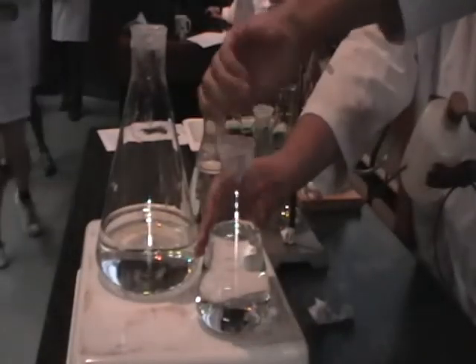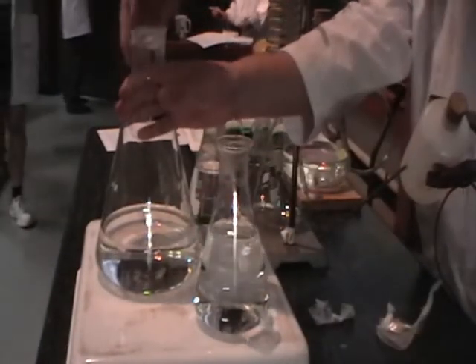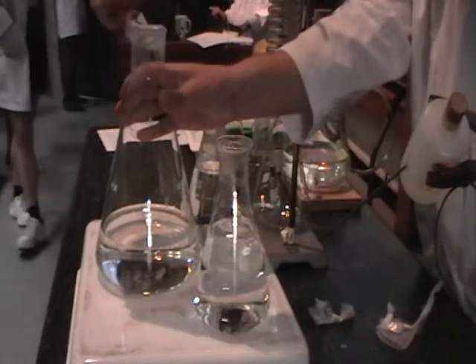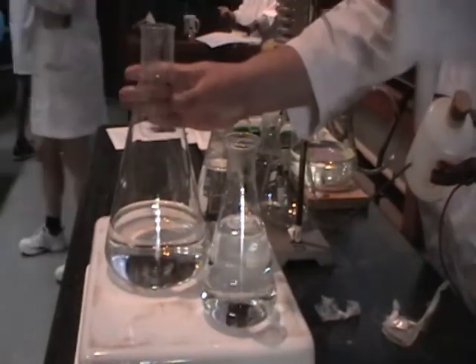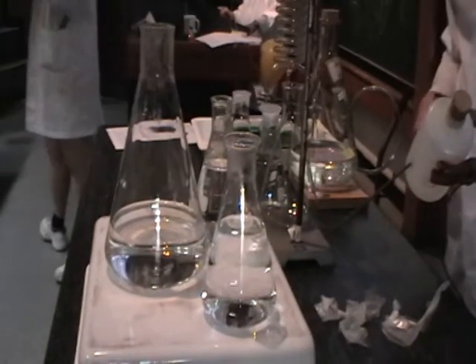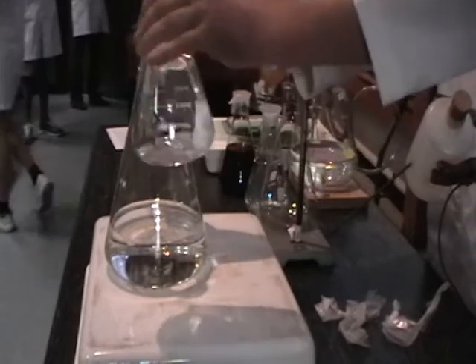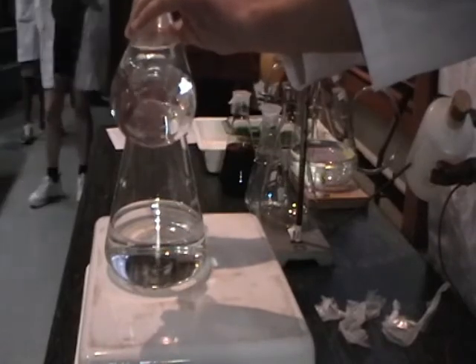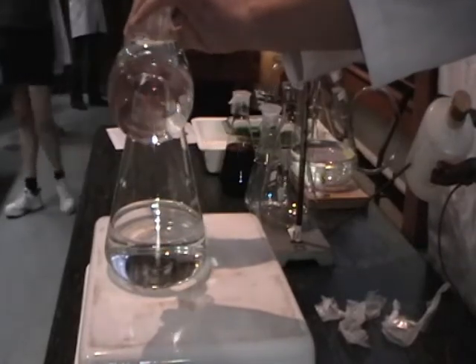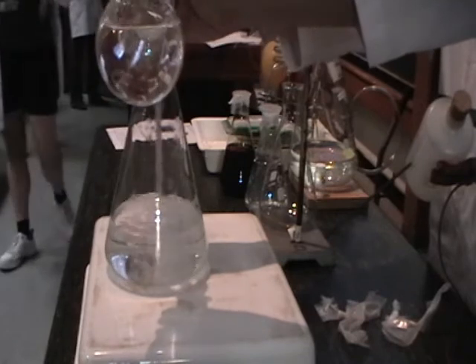Basically, we've got three solutions: one of potassium iodate, malonic acid — which is found in some vegetables such as beetroot — and hydrogen peroxide, which is what those of you who bleach your hair use every now and again.